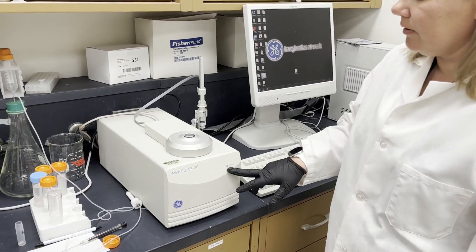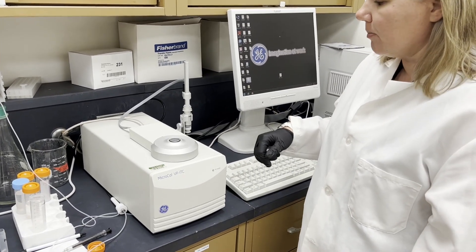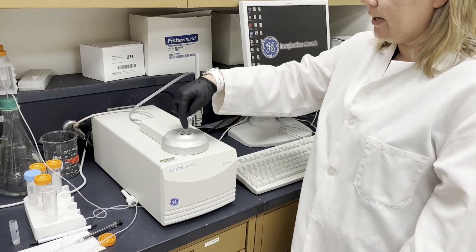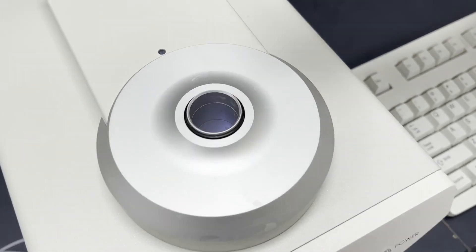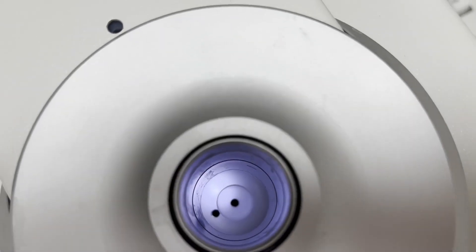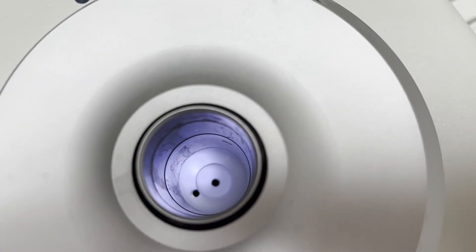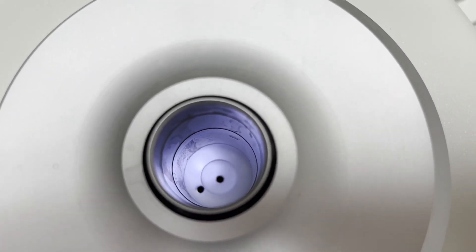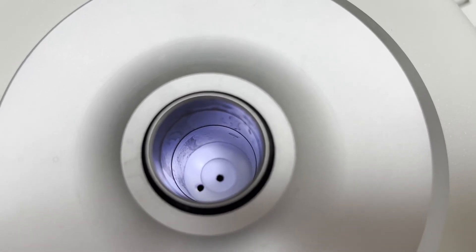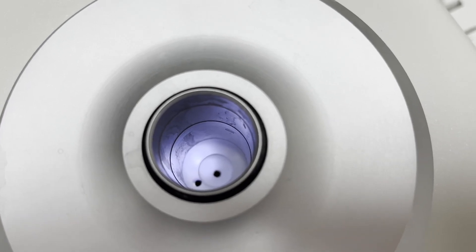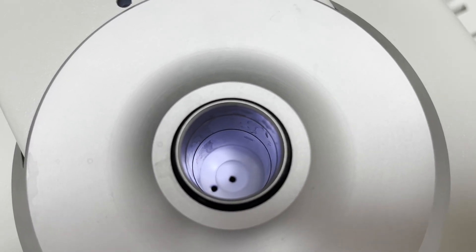In here there are two holes. On the left is the reference cell which has water in it. I change that periodically to have fresh water in there, so you really don't need to change it when you come to use the instrument and make sure that's fresh.